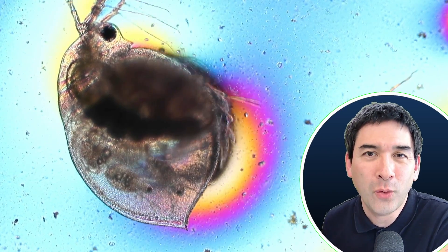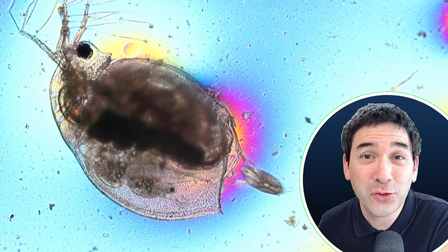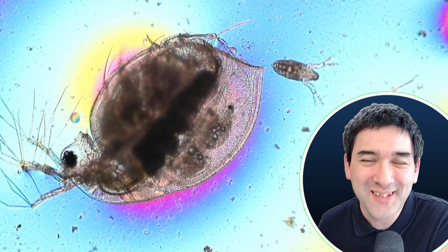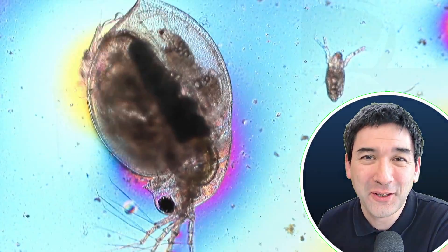Today I would like to show you how water fleas give birth to baby water fleas. Hello and welcome. Microhunter here.